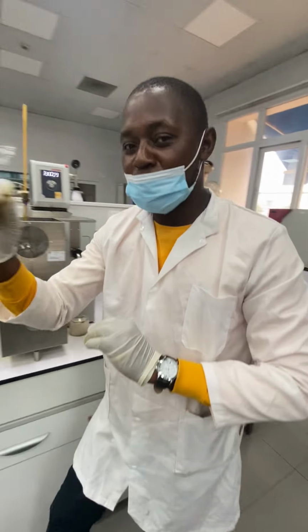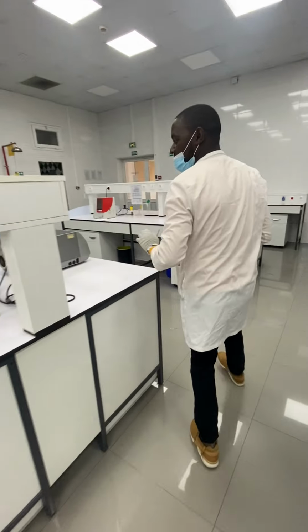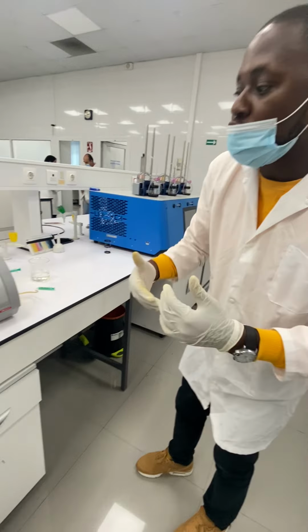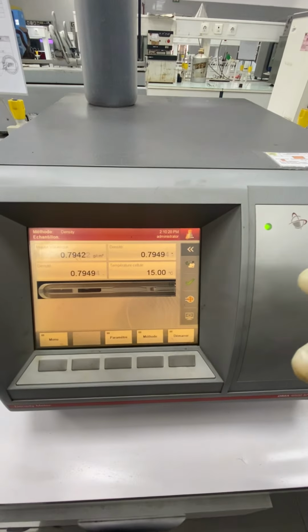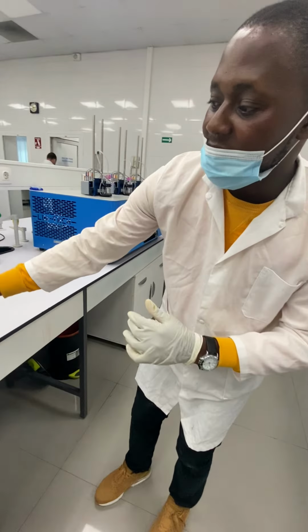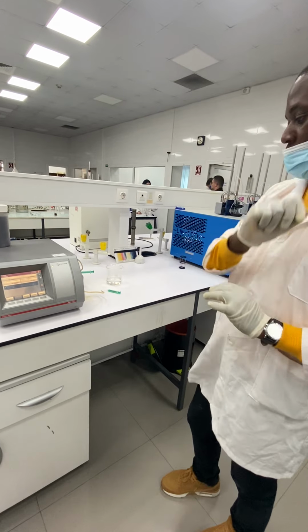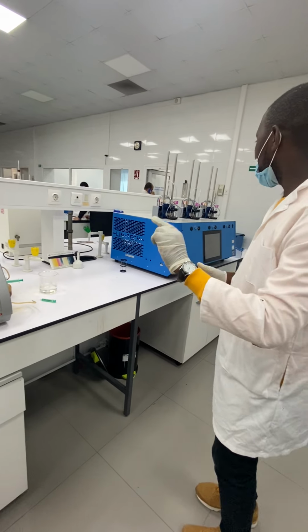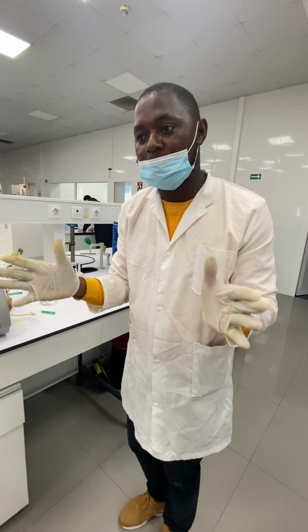And from here, I'm going to show you the wonderful machine which we have here, the densimeter. The densimeter is the machine that we use to calculate the density automatically. Here we have 0.794. See, and this density is given at a temperature of 15 degrees Celsius, I mean that is the American degree, API. And from this we also learn another point that is very important for petroleum qualities.